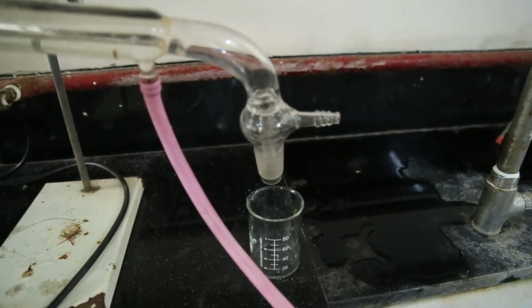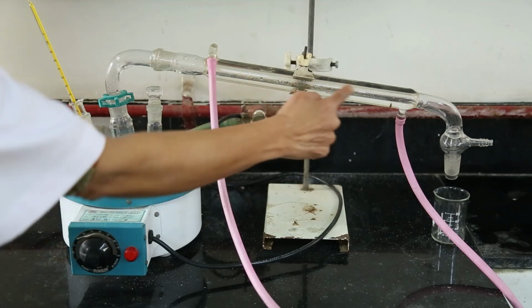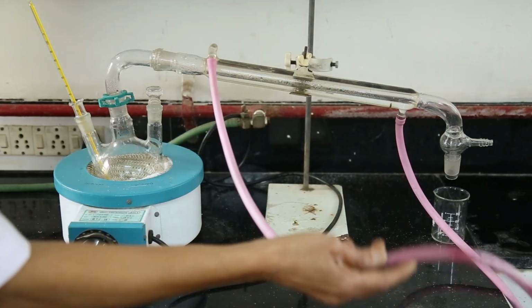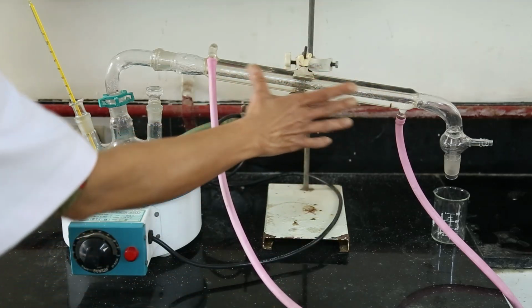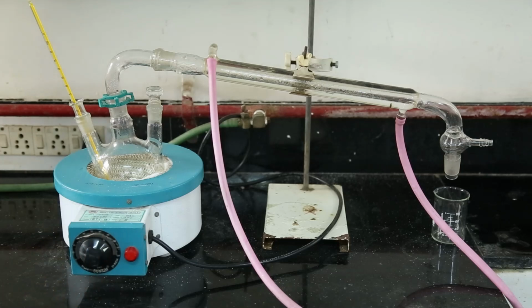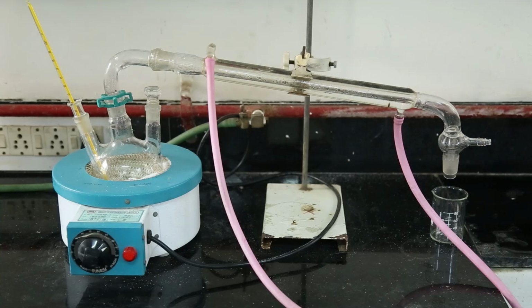When we heat the solid-liquid mixture, we will get vapors here, and by using the inlet and outlet, this vapor is condensed in the condenser tube and the water will be collected in that beaker. In this way, we separate a soluble solid from a liquid by the distillation method. On ships, drinking water from sea water is obtained by this method.